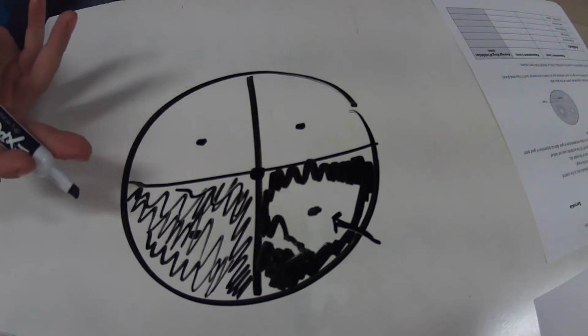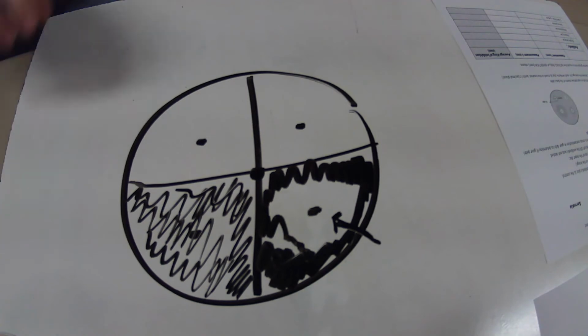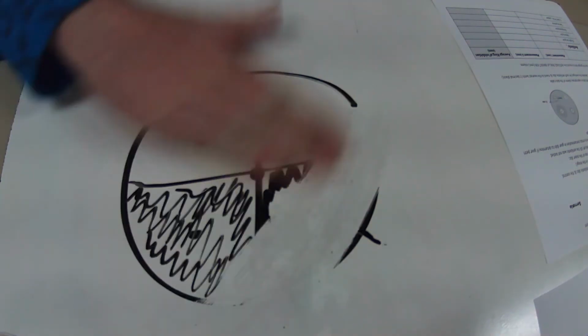So today we're going to actually measure these, take some observations, and be able to do this. Now, we're not going to go through every last measurement. You guys are going to see some of the data on Friday, but I'm going to go over just a couple things with you so we can all be on the same page. Now, let me erase this quick.